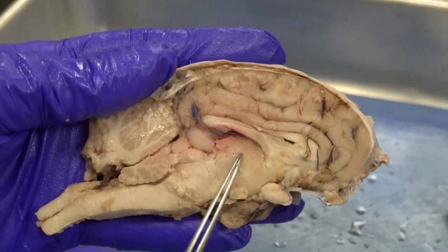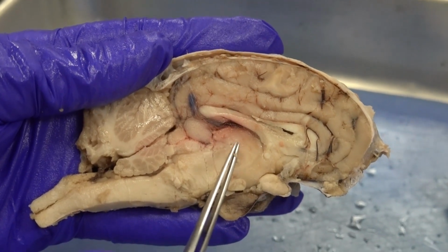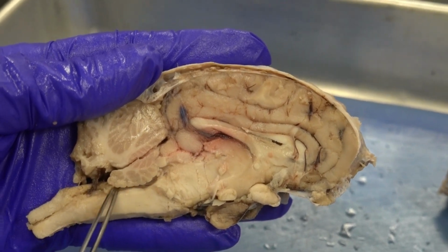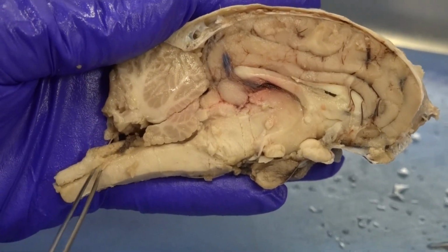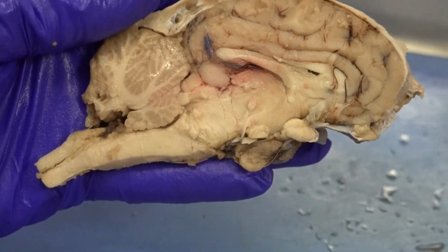And then from the third ventricle, we have obviously more production of cerebrospinal fluid, because in all these ventricles, we have choroid plexuses. And then the fluid goes into the cerebral aqueduct, gets inside the fourth ventricle, and then here, through the median aperture and lateral apertures, gets into the central canal of the spinal cord and subarachnoid spaces of the brain and spinal cord.